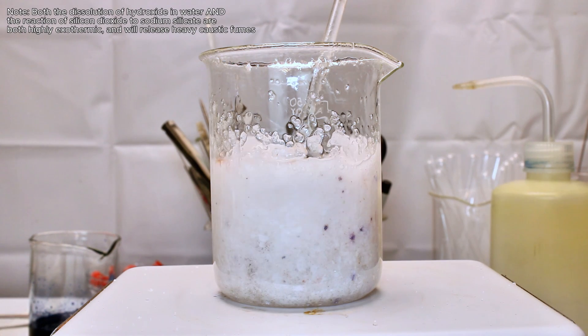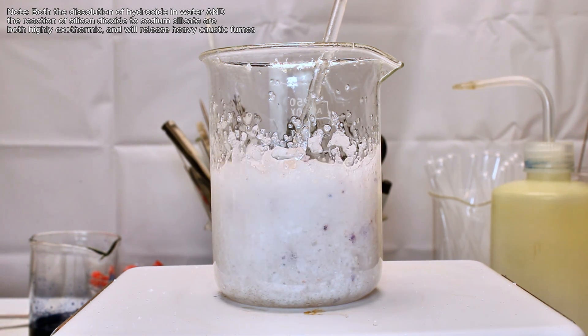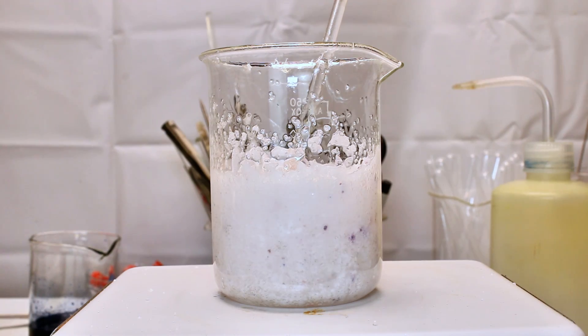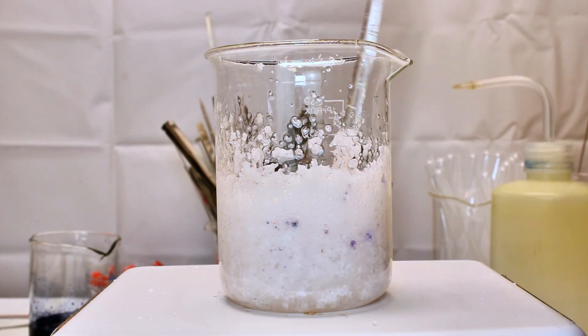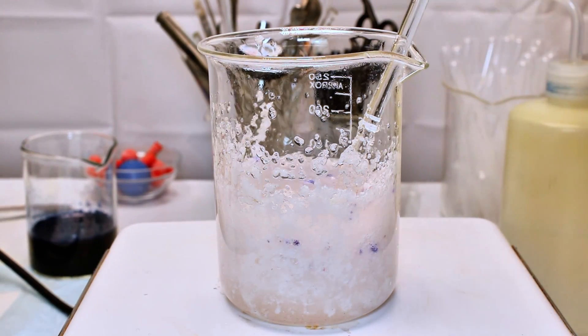The fumes here are highly caustic, so I'd recommend only doing this outdoors or in a place with good ventilation. Alternatively, dissolving the sodium hydroxide in water before adding the silicon dioxide would probably have made this reaction a lot less violent.